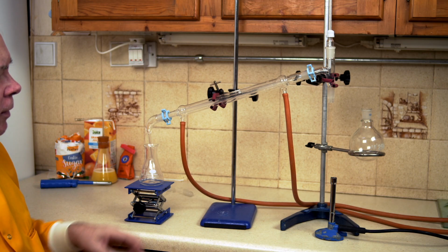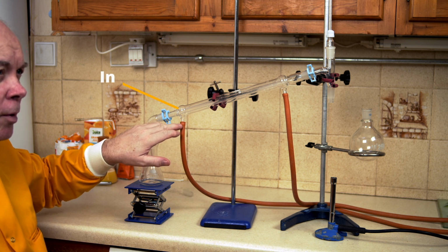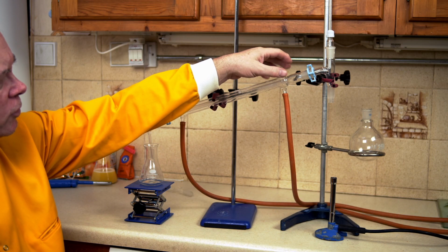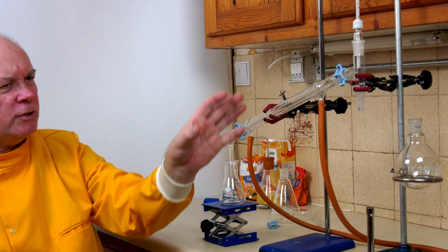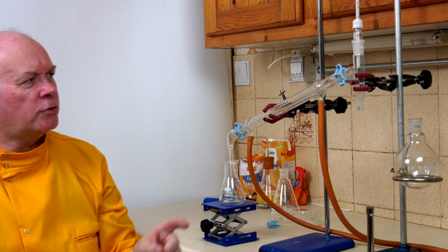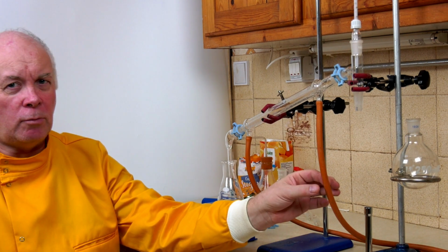In practice, there's one more little thing that we need to take care of. When we drew the diagram, I set the water to come in through the bottom and out through the top. Now this does seem a bit wrong, because we'd expect the coldest water to be up here. But we'll see. So I've set it up wrongly, and what we're going to do now is put the water on, and we're going to see why and what happens when it's set up wrongly.